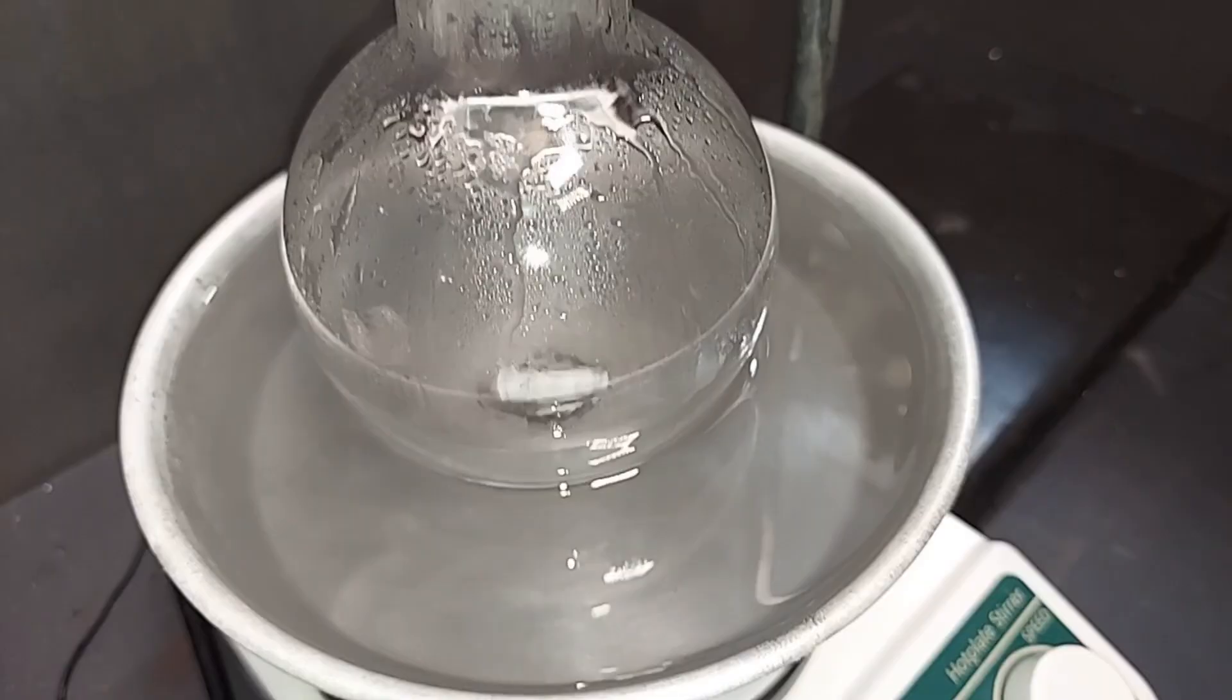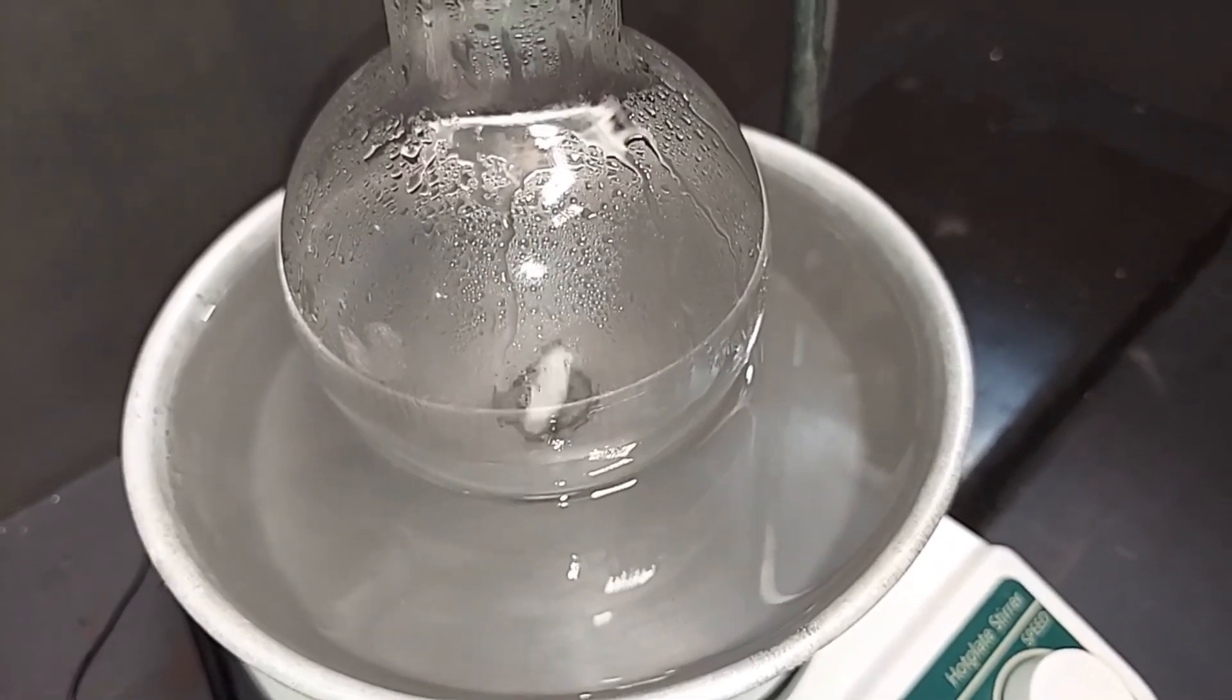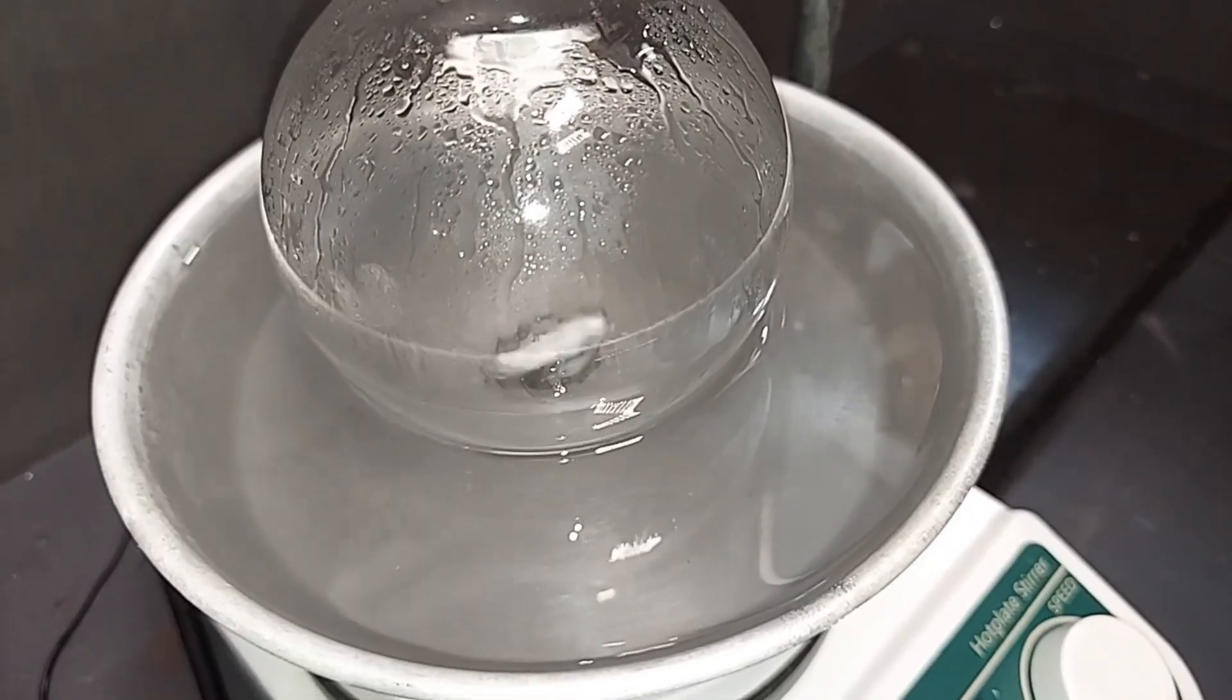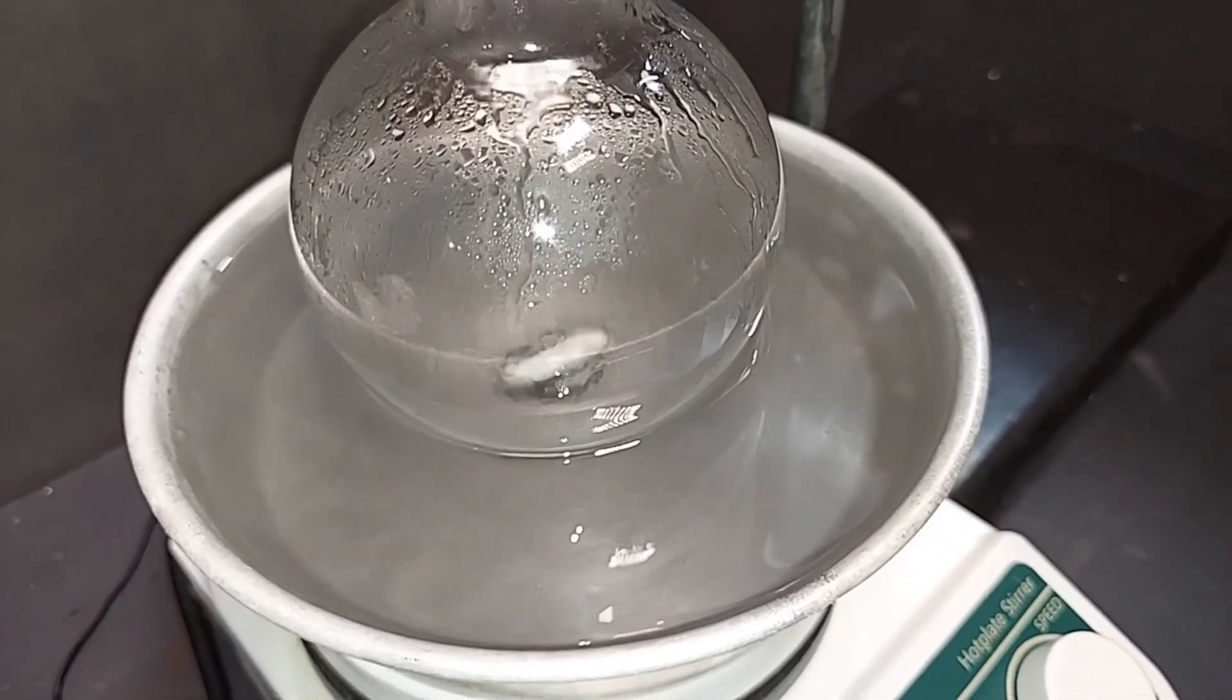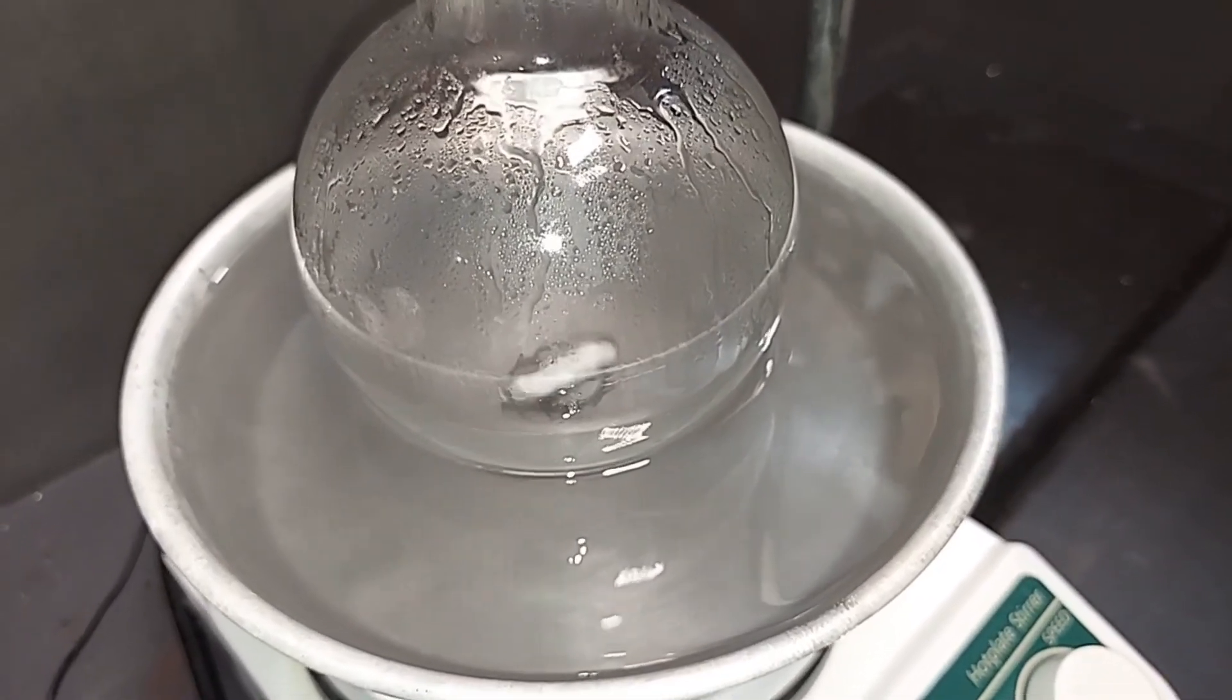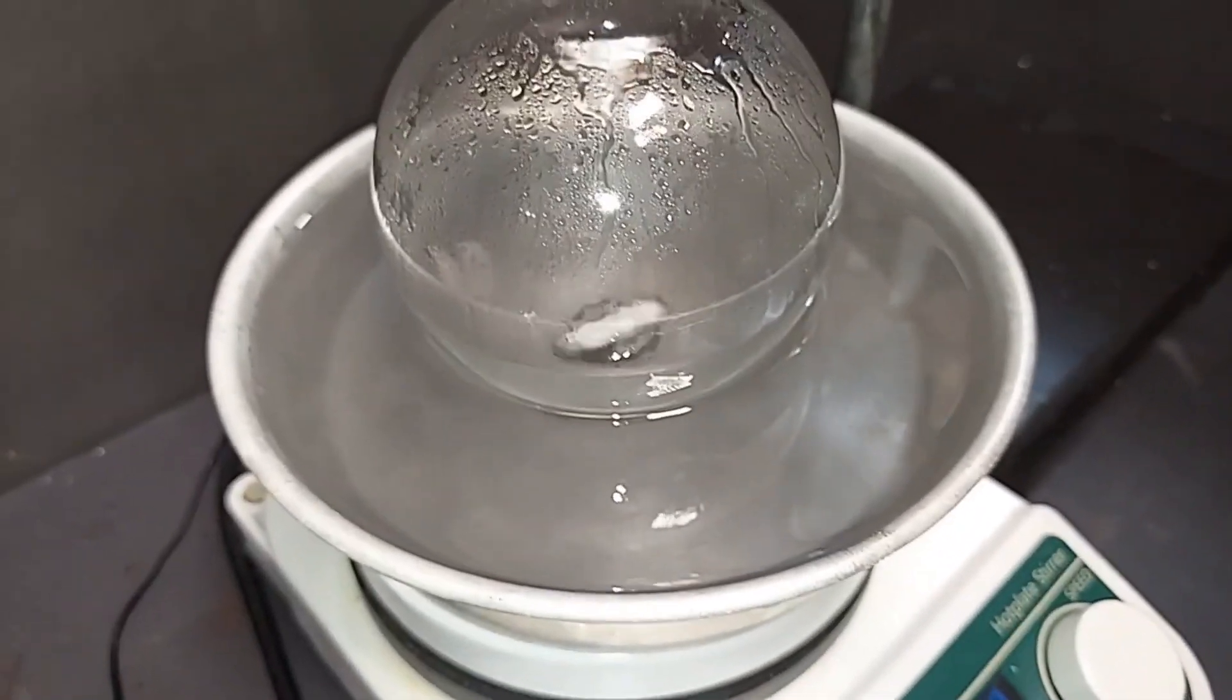I do want to make one quick comment. I use an aluminum pan here because it was non-magnetic, but that hot oil with the spinning magnetic stirrer has just ground up tons of small particles of aluminum and you can see them swishing around in the oil. So this will permanently be the oil I use for hot oil. Time to turn this off.